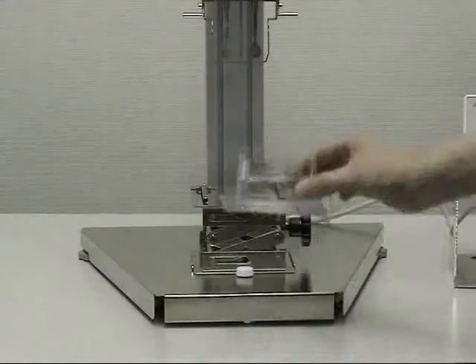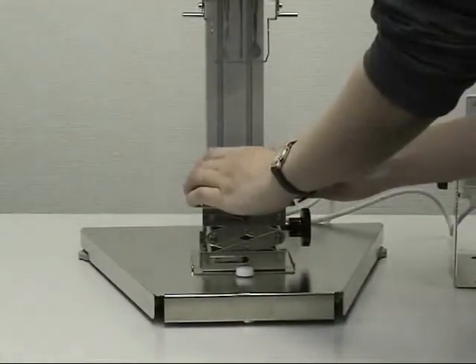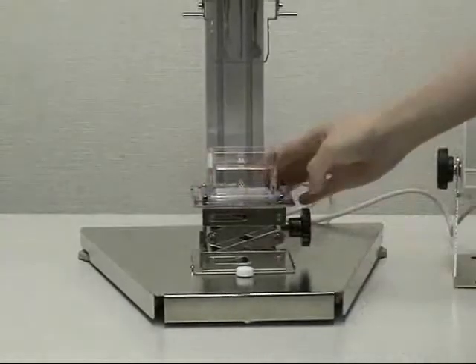To measure a sample, place the sample cup on the table. Push the sample cup into place held by the guides.